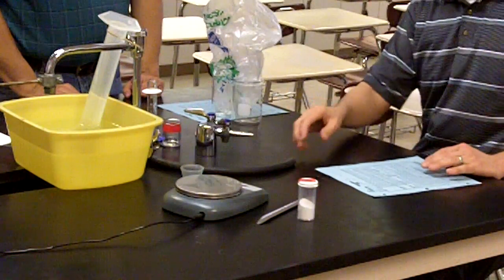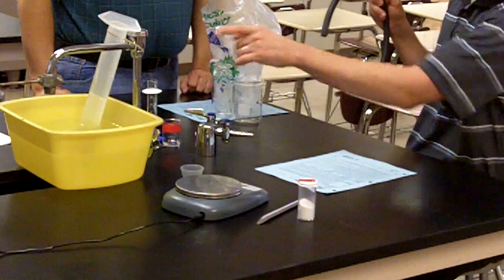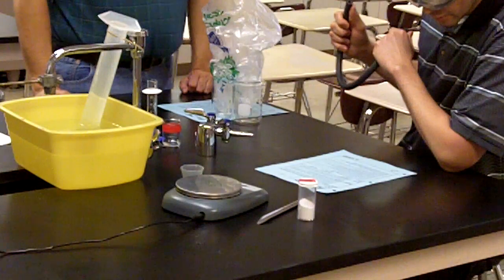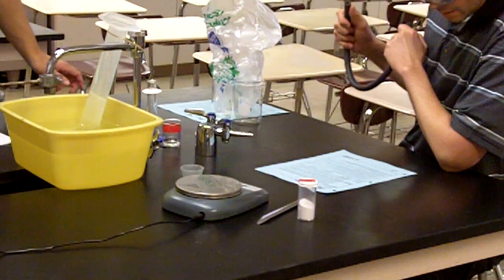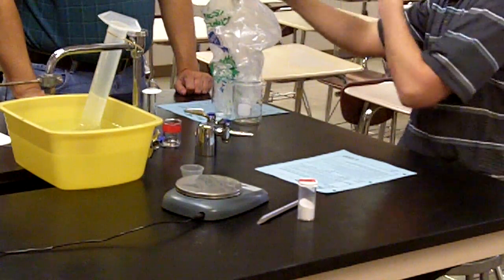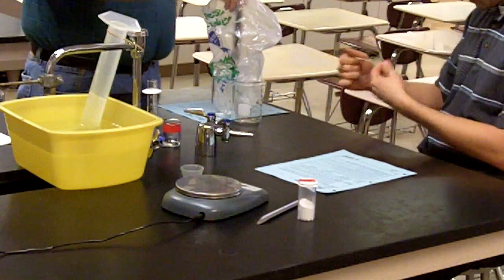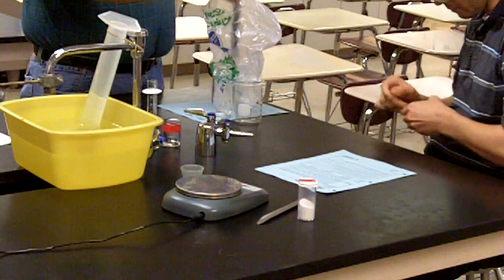What we have to do is make sure that there's a way for the gas to get through from the baggie that has produced it into the graduated cylinder. And the tubing, the steps described in this procedure here, steps 8, 9, and 10, are to connect the tubing here and to get it in there. Go ahead and hold that, Mr. Records. So the beakers are there to keep the reactants themselves separate from one another.